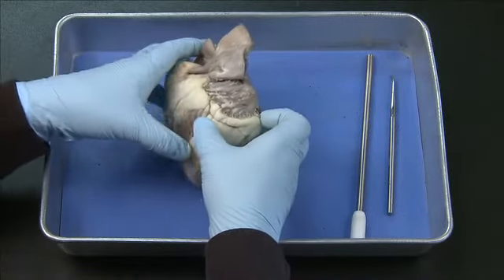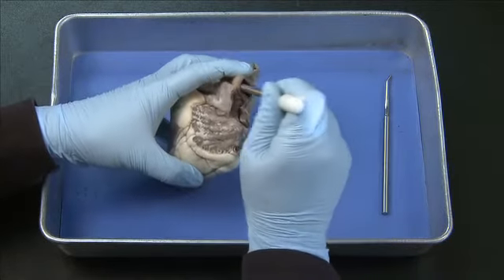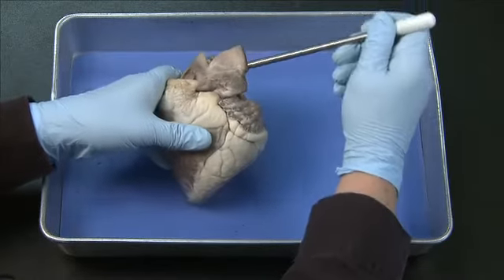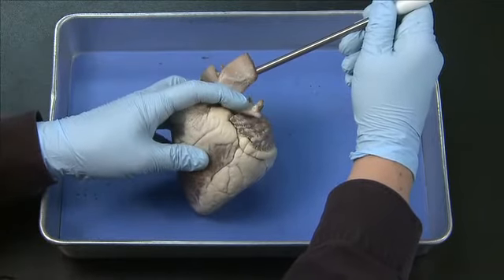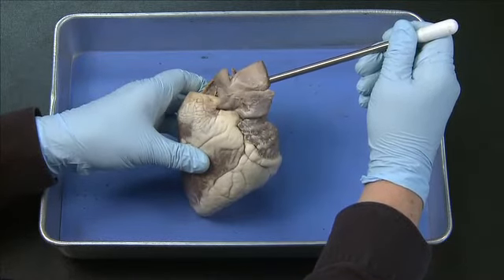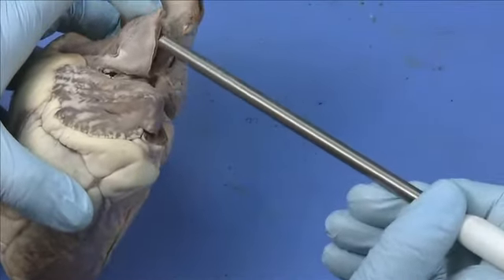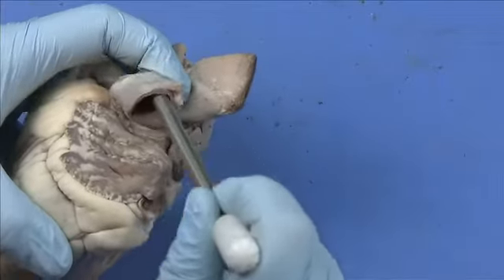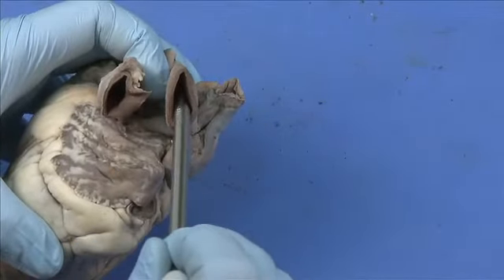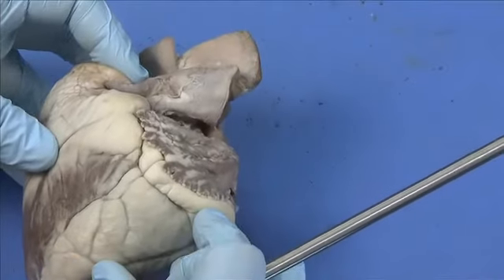The other large vessel that you can see on the exterior view of the heart is the aorta, a large diameter vessel just posterior to the pulmonary trunk. In this view, you can see one of the two branches off the sheep aorta. Let's take a closer look at the pulmonary trunk and the aorta — here's the pulmonary trunk, and just posterior to that is the aorta, so you can see how those two blood vessels are oriented on the heart.